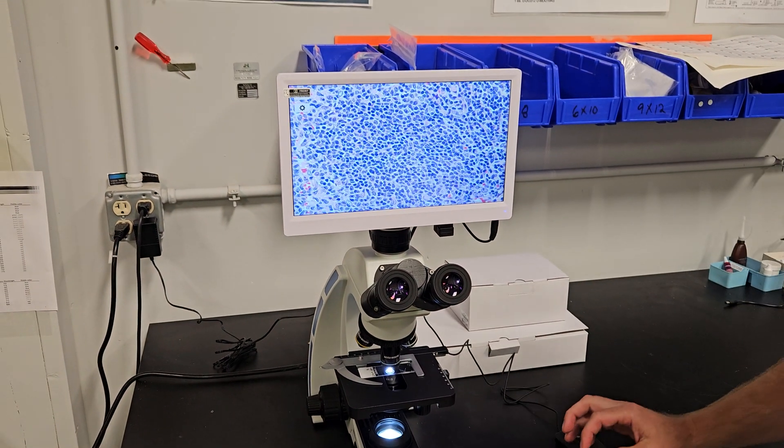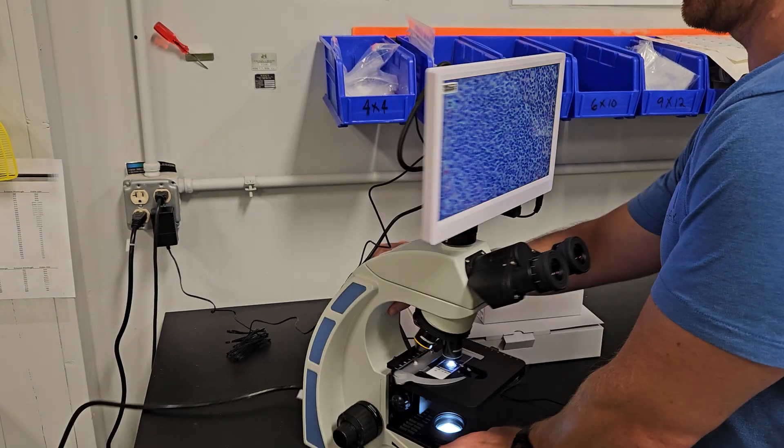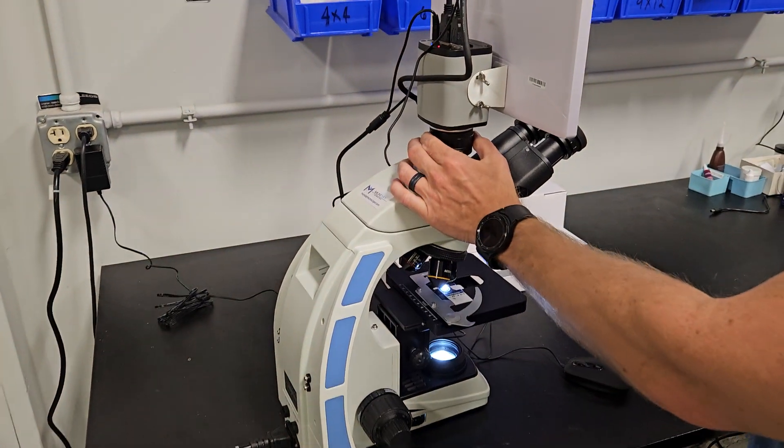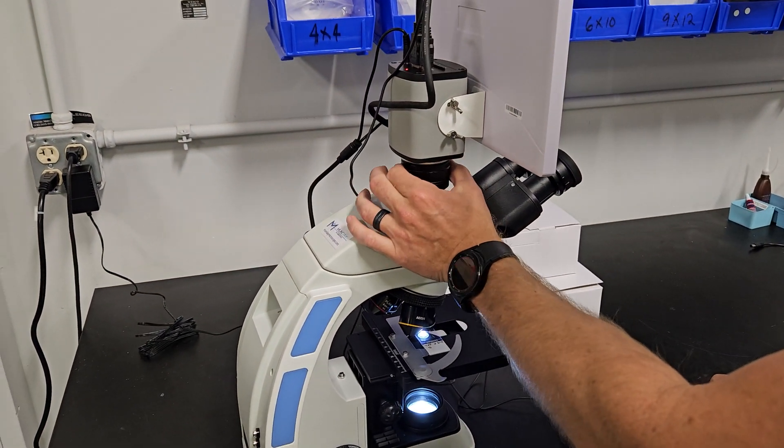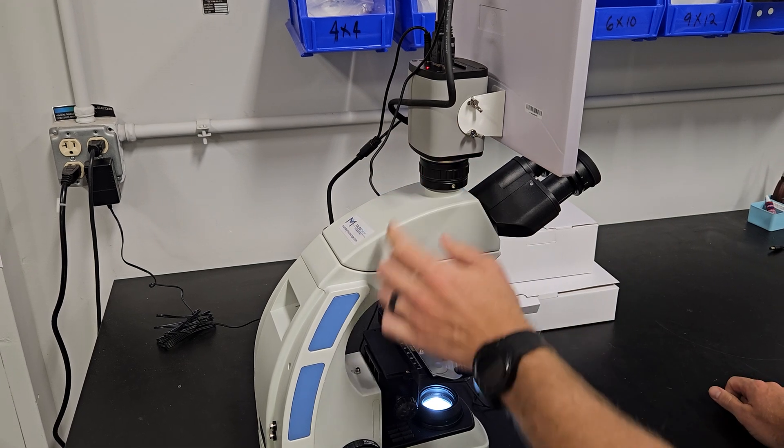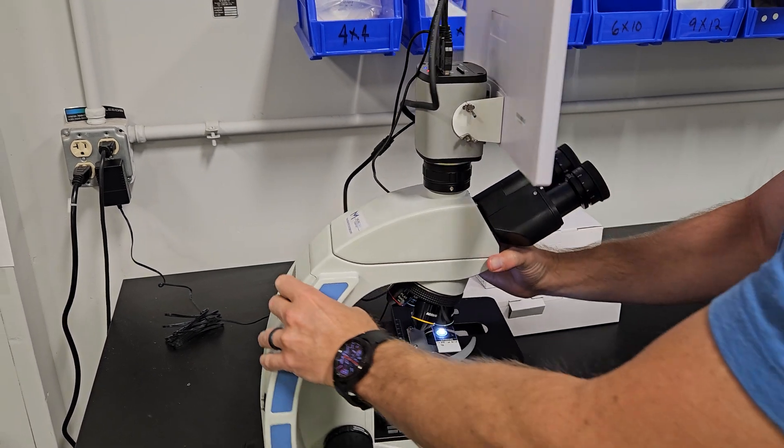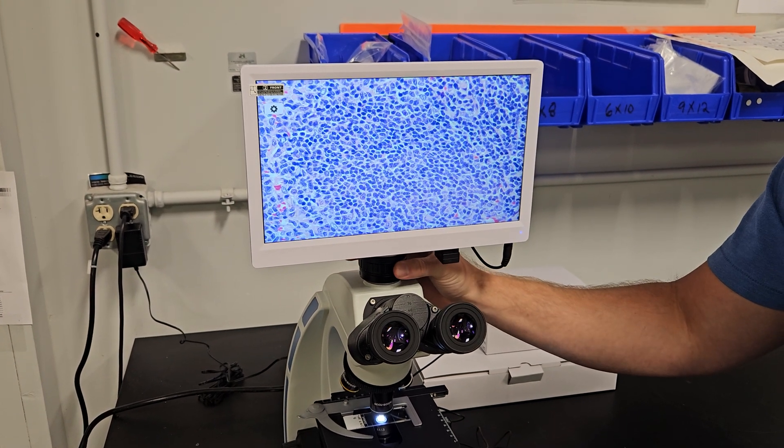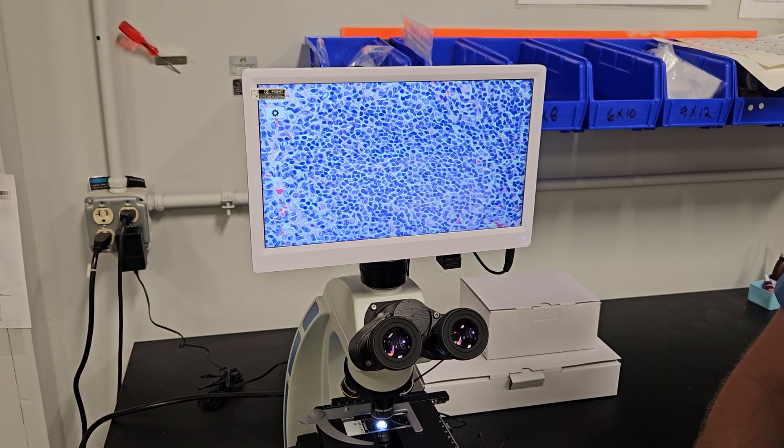So one cool thing about this is on this scope and many others you can focus the camera right here. Whatever you see through the eyepiece you can bring it in and out of focus. See I'm moving that right there to bring it into perfect focus.